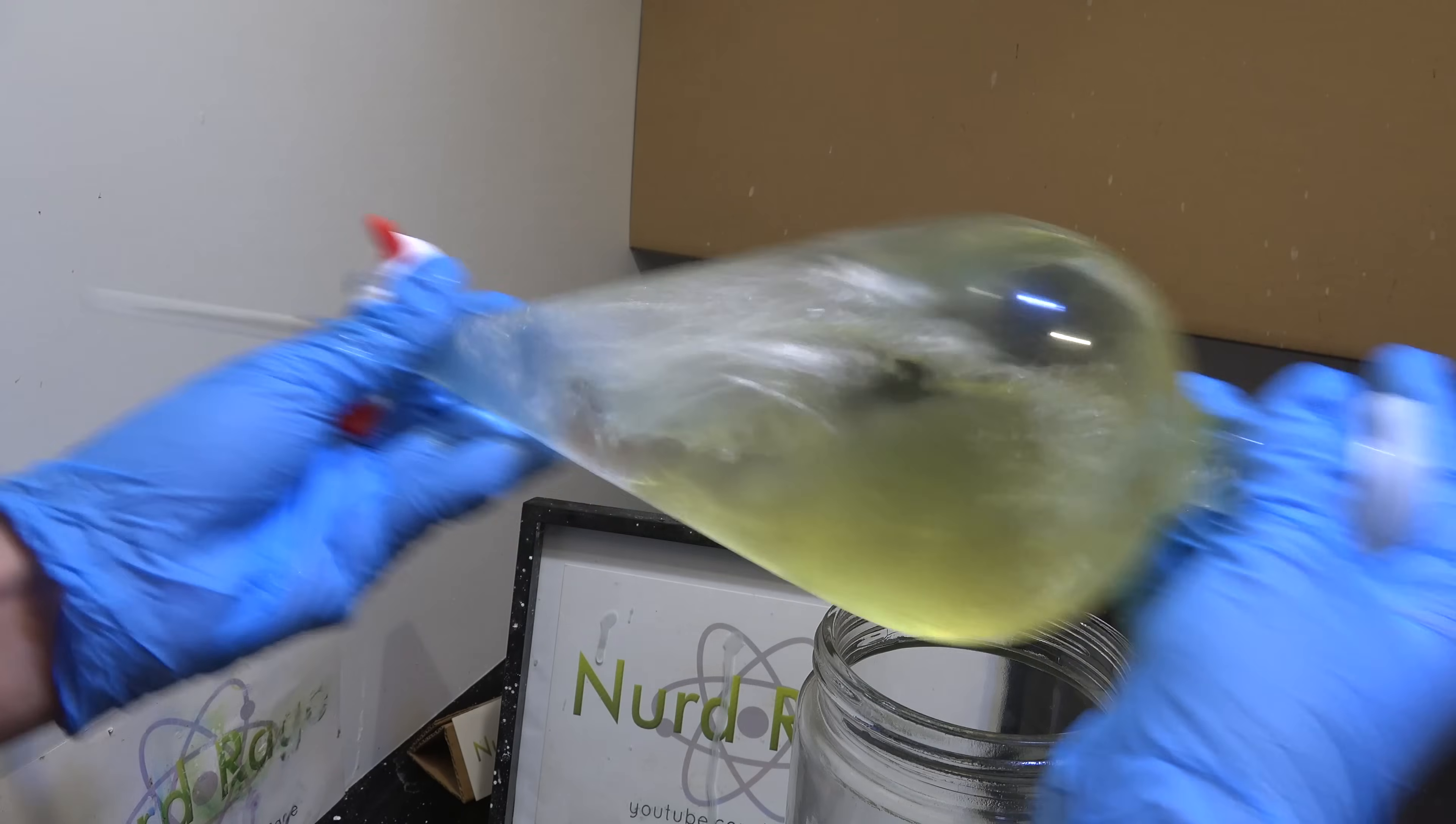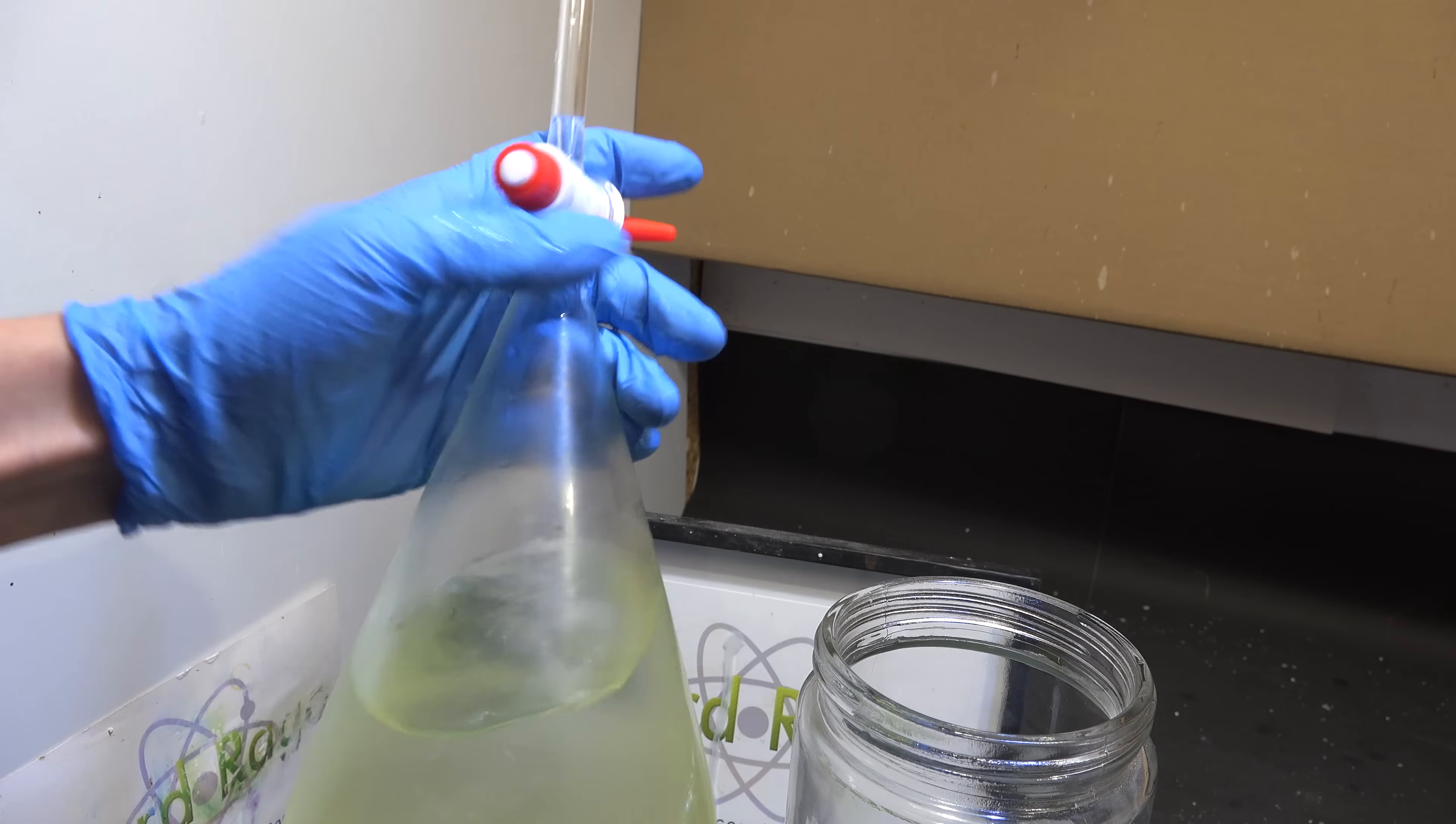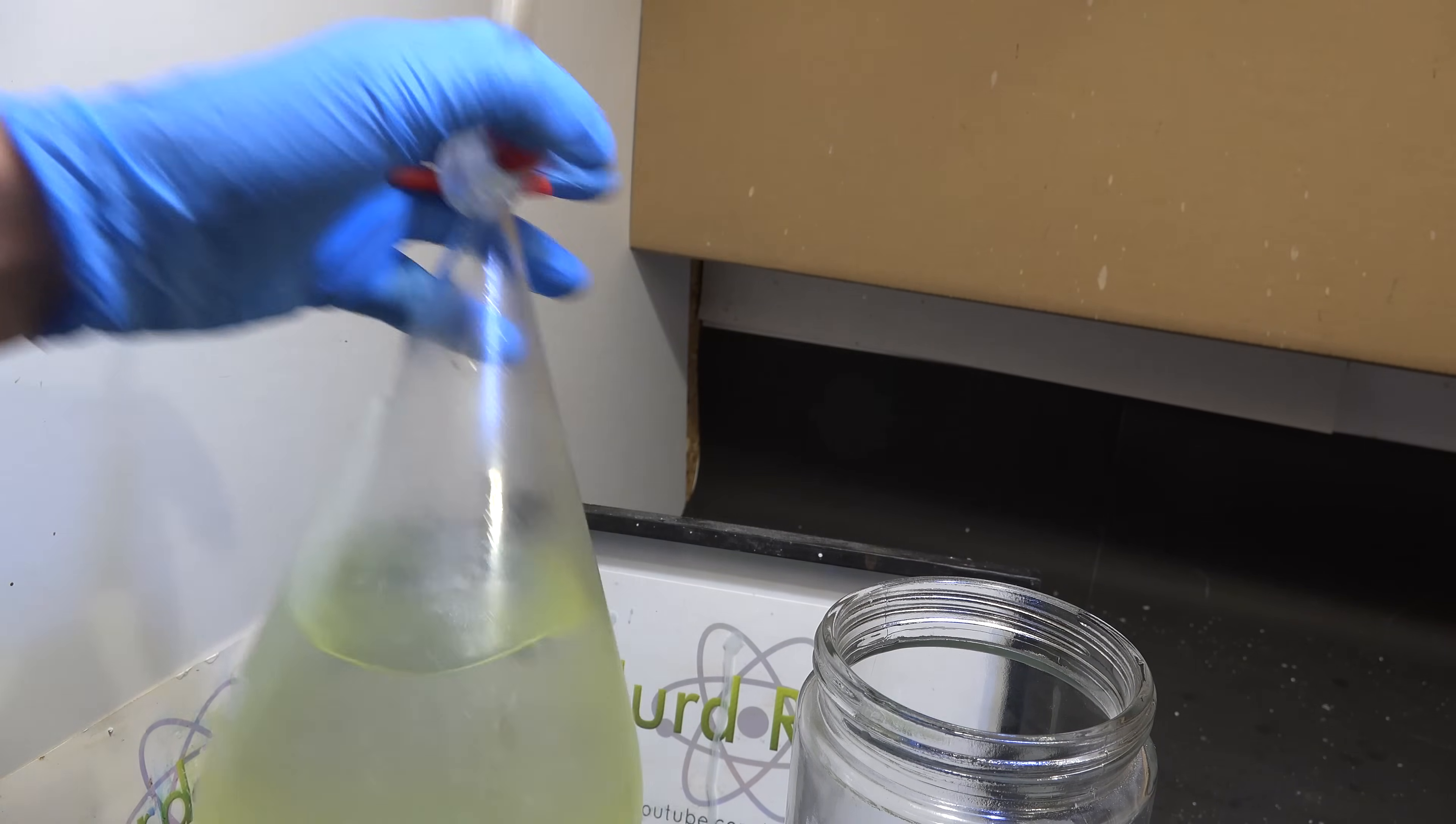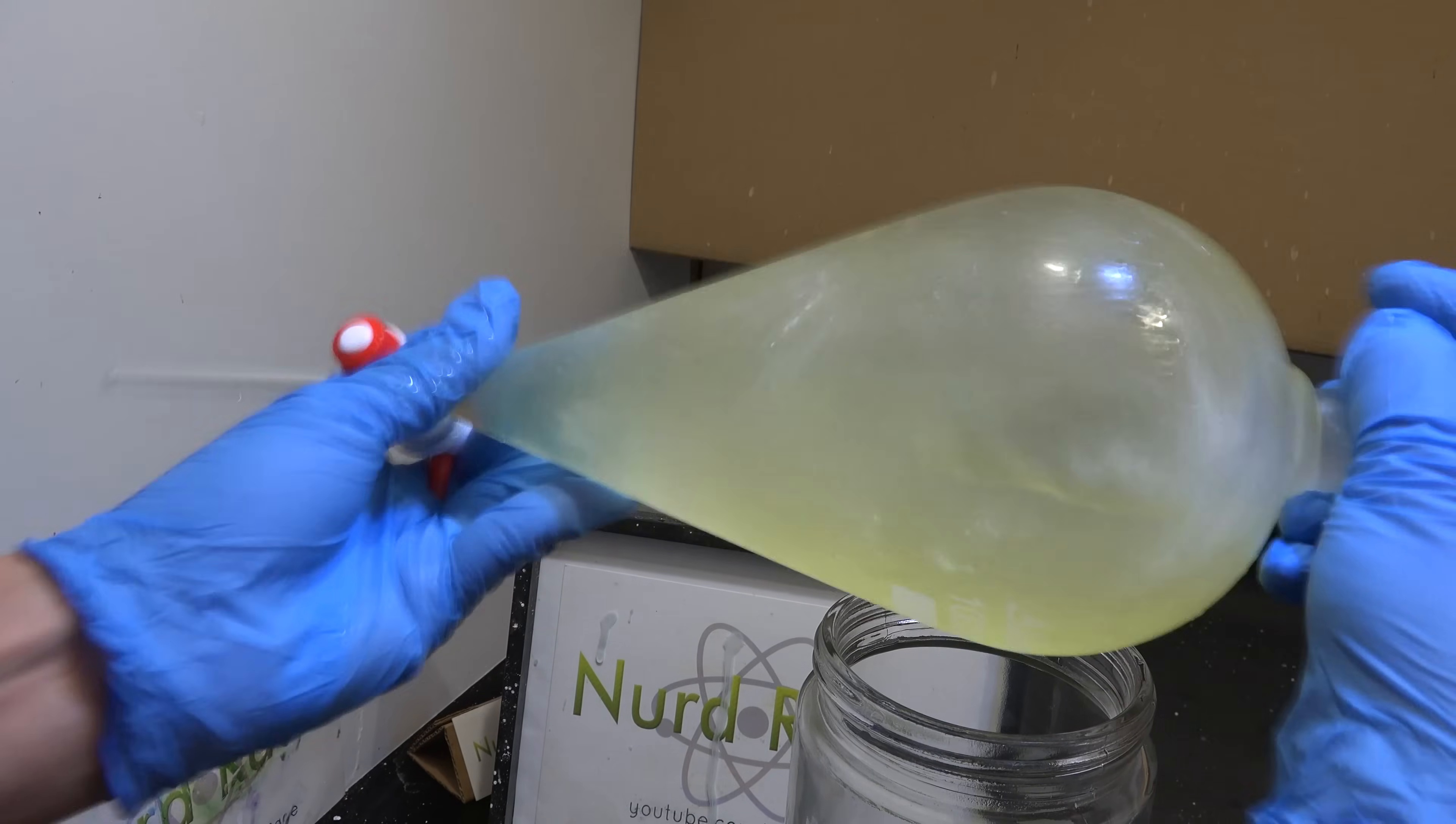In this video we're going to use a solvent extraction method to recover even more gallium. The idea is that we're going to selectively dissolve gallium chloride into ethyl ether but not aluminum chloride. This allows us to concentrate the gallium for easy recovery.